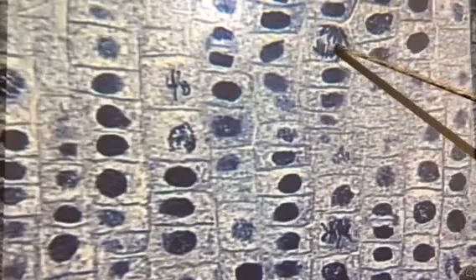So to get one that's in anaphase, where you're actually seeing the chromosomes being pulled apart, is the most rare, but you'll see them. This is a great one right here. So this is a classic example of anaphase. You have these spindle fibers in here, which you can't see on this kind of microscope, but they're pulling the chromosomes apart. And once they get pulled apart, there's going to be another cell wall that forms right in the middle. That's called telophase, but we're not there yet. So here's a classic example of anaphase.